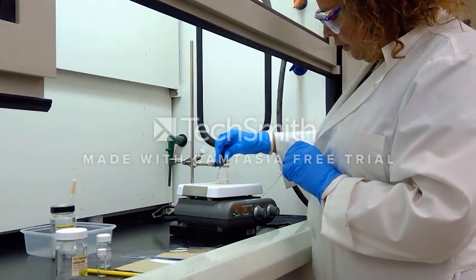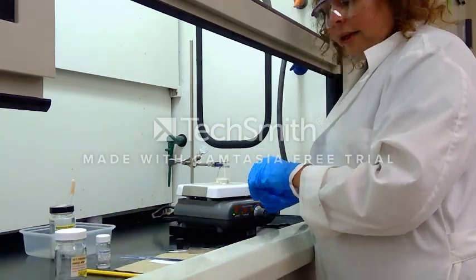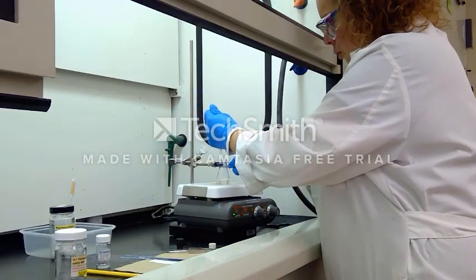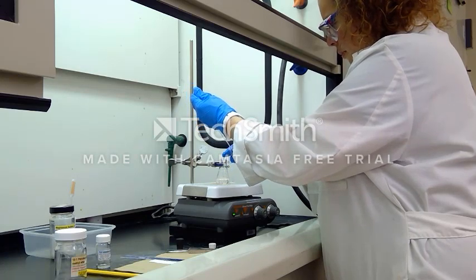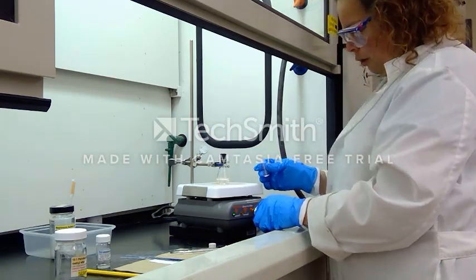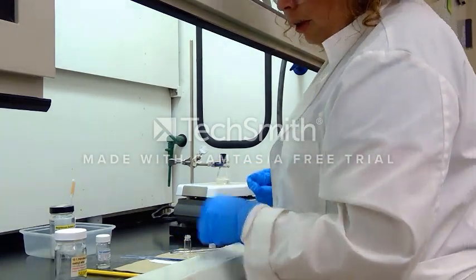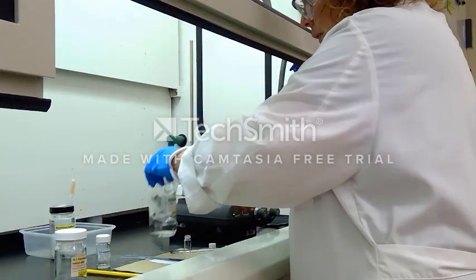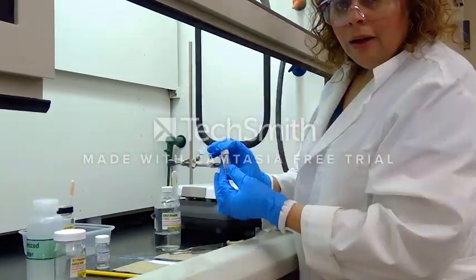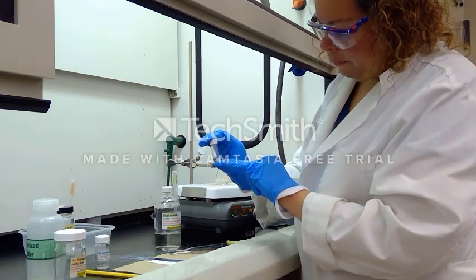It has been about 30 minutes since we let the reaction start and we're going to test this by TLC. The textbook says to test after about 15 minutes, but we let it go double the length of time. I'm taking a few drops of sample — about three to four drops — putting the cap back on to allow it to continue stirring, and adding half a milliliter of ethyl acetate and half a milliliter of water to my TLC sample.